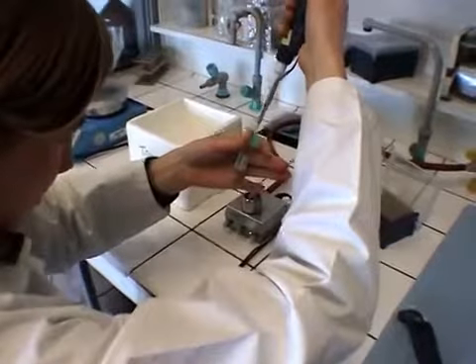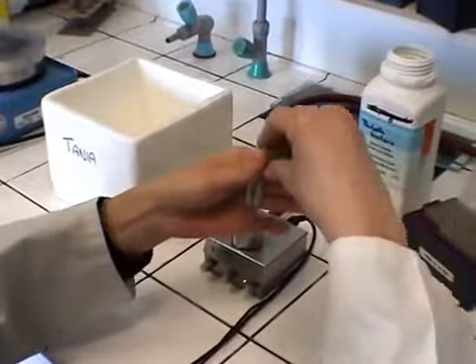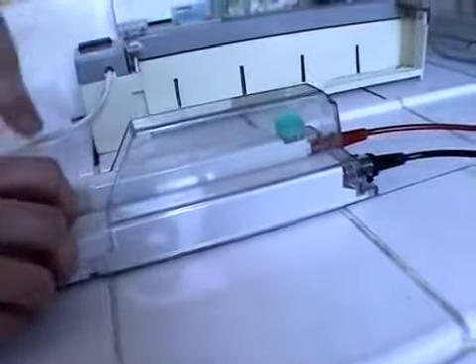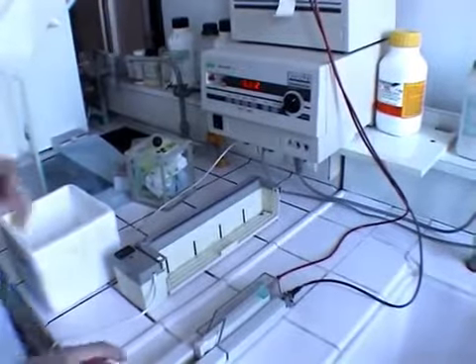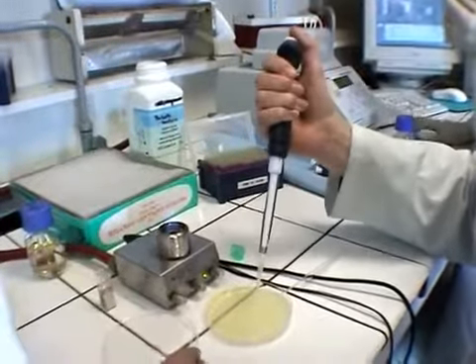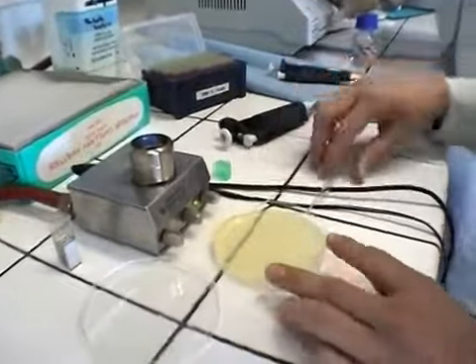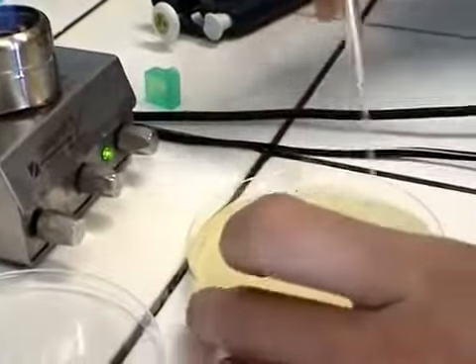Once the gene is cloned into the plasmid, a solution containing the plasmid is mixed with bacterial cells. A series of electrical discharges at high voltage facilitates the penetration of the plasmid, thus carrying the gene into the bacteria. Next, the bacteria are spread over a culture dish, and the bacterial colonies that have incorporated the plasmid correctly are identified by their white colour.